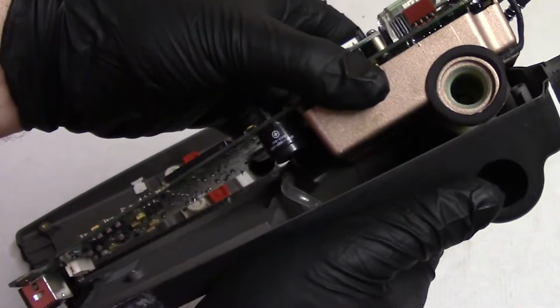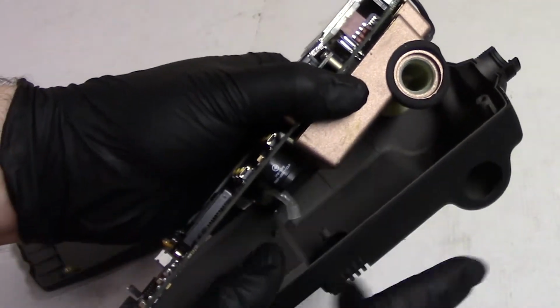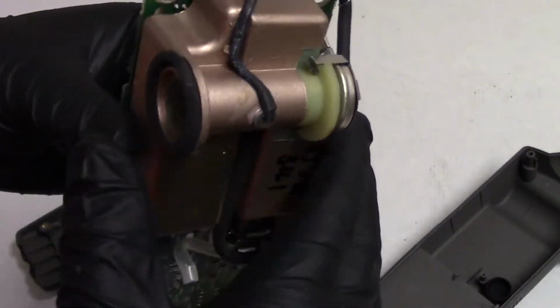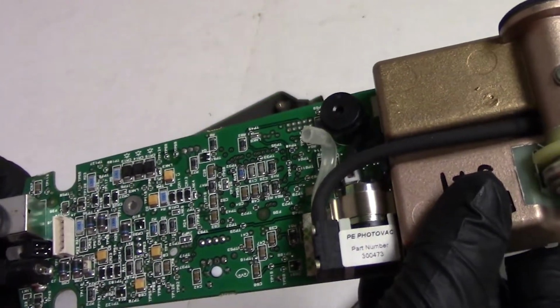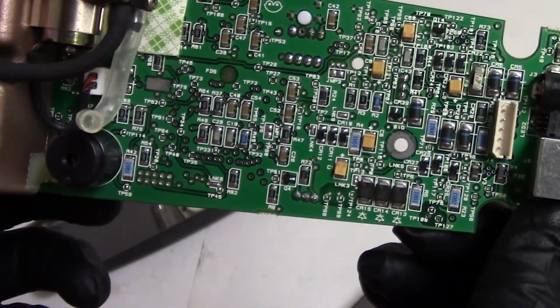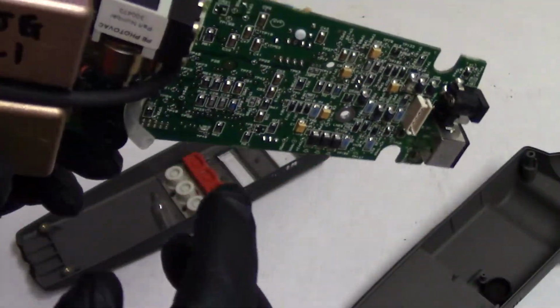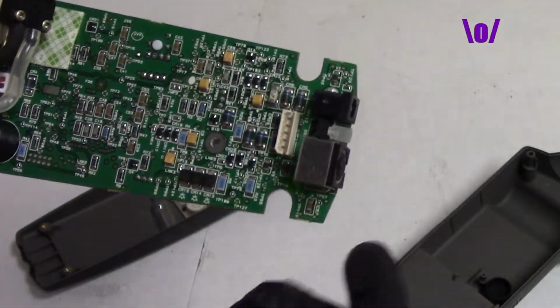One of the reasons I wanted to look at these was to see if I could repair them, because I'm always looking for new things to learn how to fix. Probably hand assembled, definitely machine built, but hand assembled. It's a lot of test points. Look at all those test points. Probably calibrated in the factory. You can see that's where the battery would plug in right there.